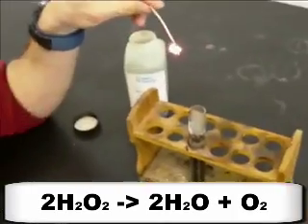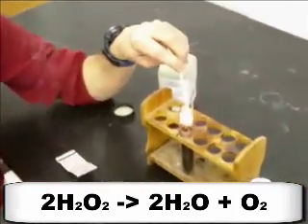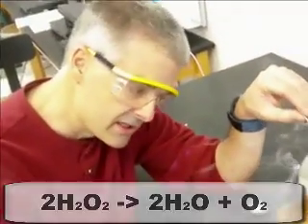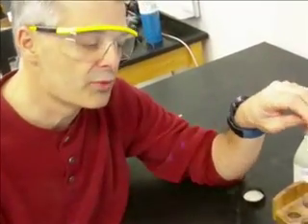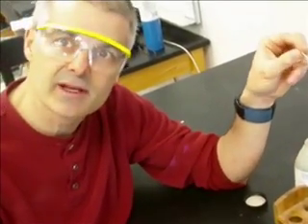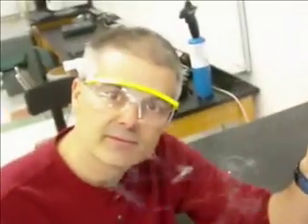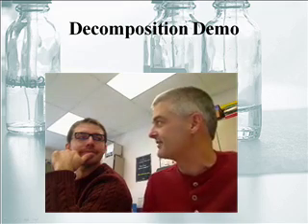And actually, this is a combination reaction and a decomposition reaction at the same time. We're decomposing the hydrogen peroxide to produce the oxygen gas, and as I produce the oxygen gas, we're actually having a combination reaction, hydrogen plus oxygen makes water. So pretty cool.